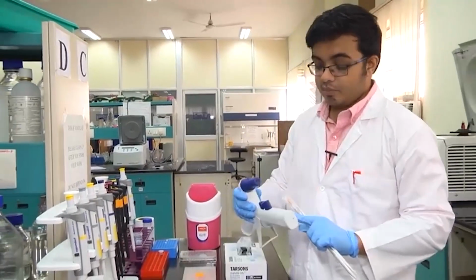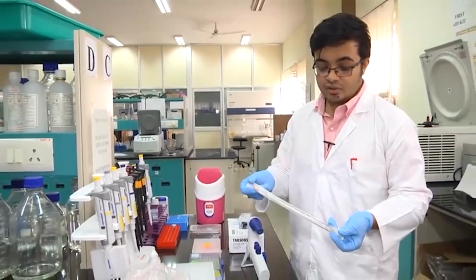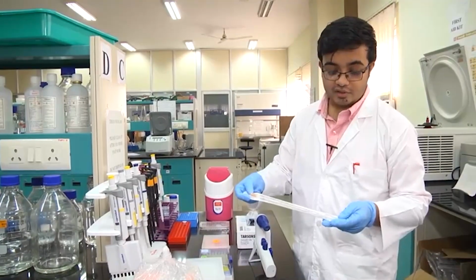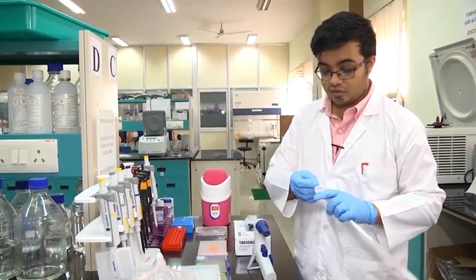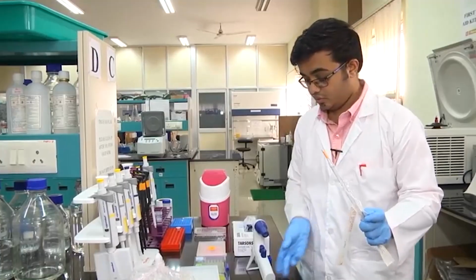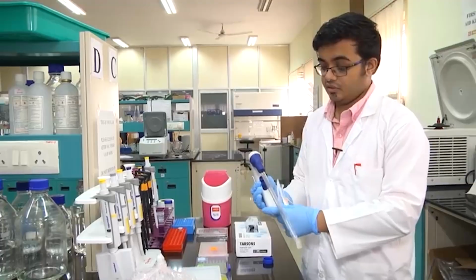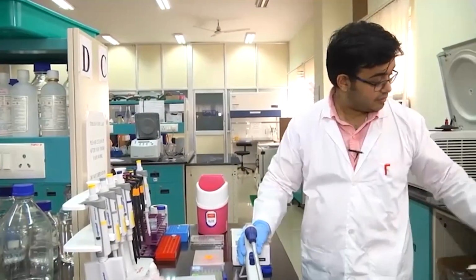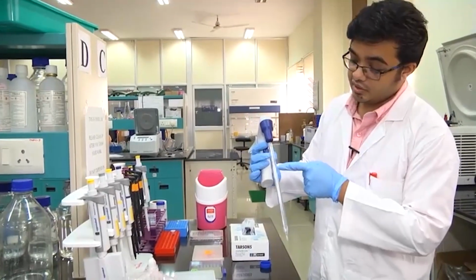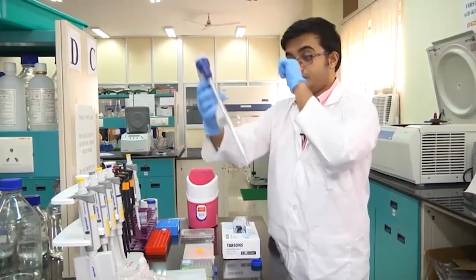This pipette controller does not use these sort of tips. Instead, they use serological pipettes. This is present in a sterile format, in a sealed condition. Once we break the seal, we have to use it up. So, I am going to just take out this serological pipette, affix it to this, and this is what we are going to use. You will notice that this can collect a volume of up to 10 milliliters. So, let us do that.